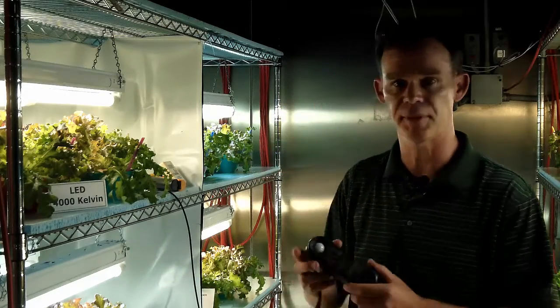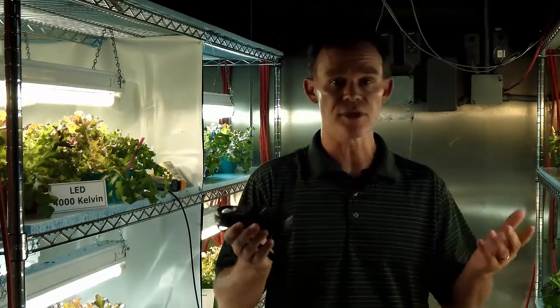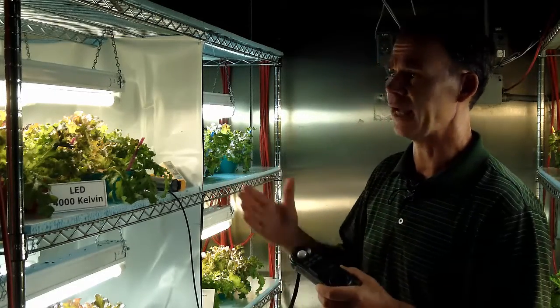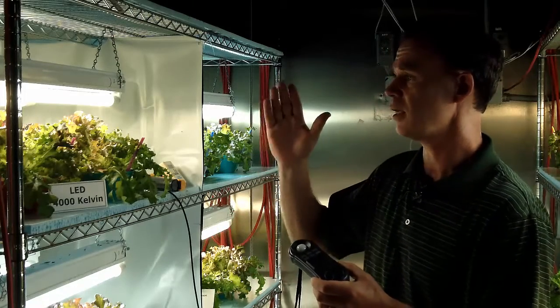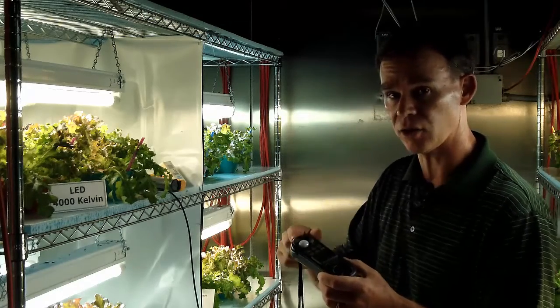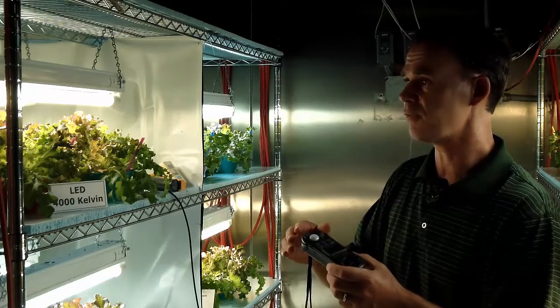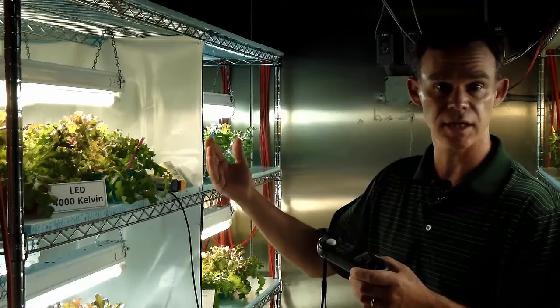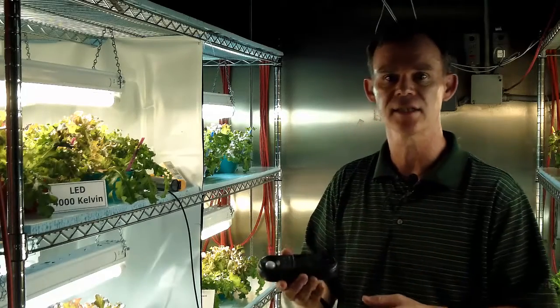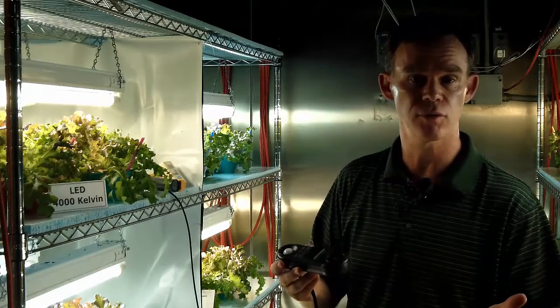In comparison, this, for example, is a lux or foot candle meter, and this would not be useful for measuring light in photosynthetically active radiation for LEDs or fluorescents, because this is measuring the intensity for our eye, the human eye, and not for plant growth. So there can be some big differences in the amount of PAR, photosynthetically active radiation light, for different amounts of lumens. You can't really look at the lumen output from an electric lamp and know whether it's going to be a good light for growing plants.